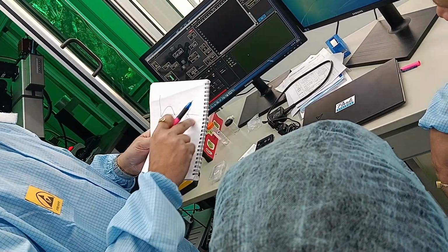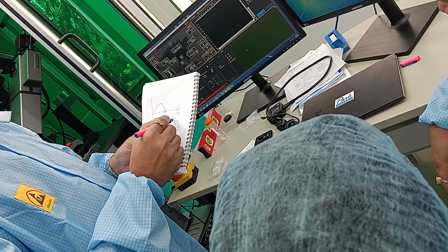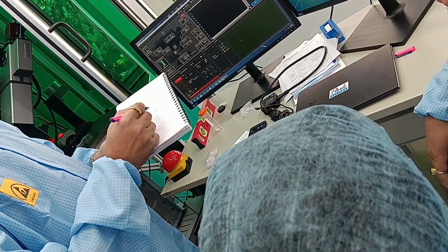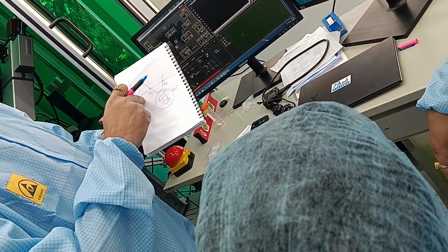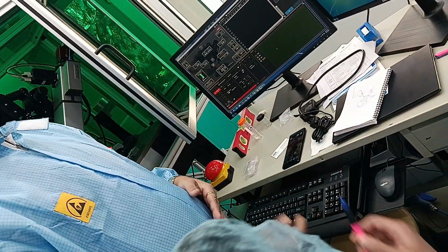So when you are doing this, the only way to evaluate is to turn the sample. You need to have a turntable, which we call a theta stage, which moves 360 degrees. So you have a sample here, you move this like this, or you can move it this way or the other way around, and you can select the positions, and it will tell you whether the sample is isotropic or anisotropic.